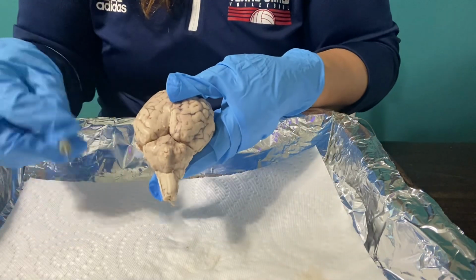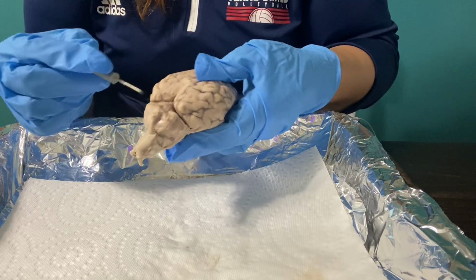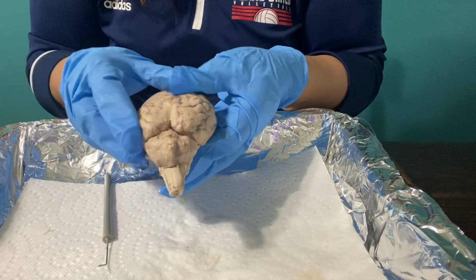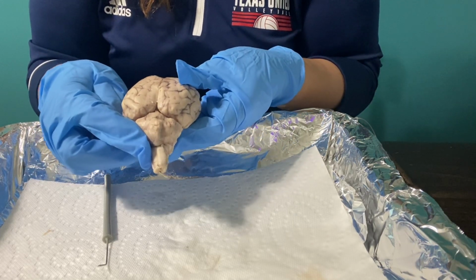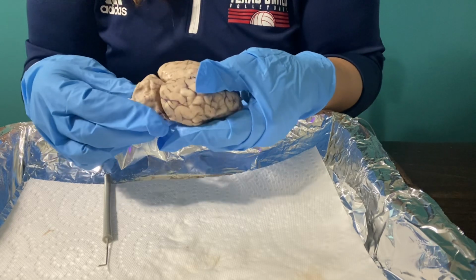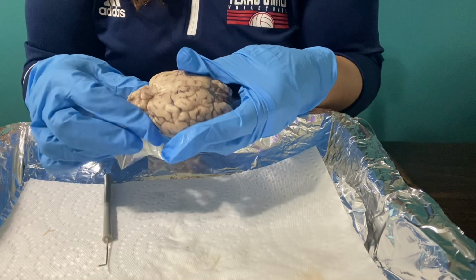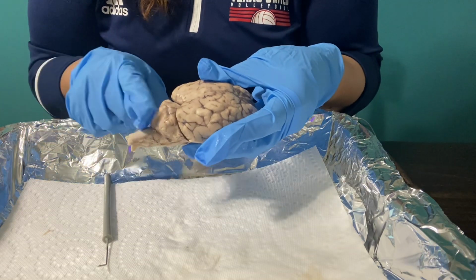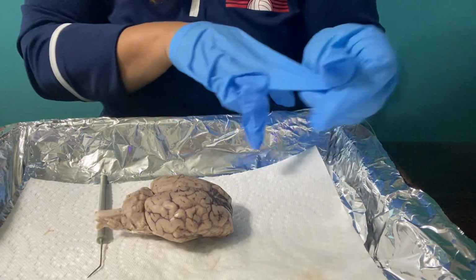And then on the very, very back, you see this little part right here. Let me turn it over. This part right here, that is the cerebellum. Okay, I don't know if you can see that. The cerebellum helps collect incoming sensory information. It makes you have those coordinated movements. This is basically how you regulate that wide range of functions and processes, both in the brain and in your body. So let me put that down.